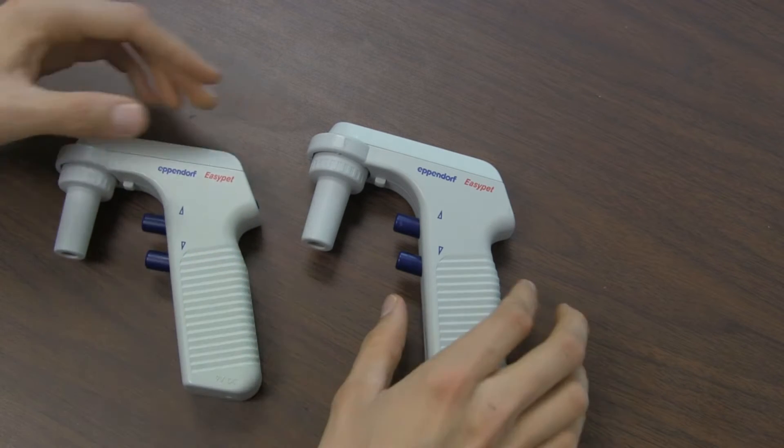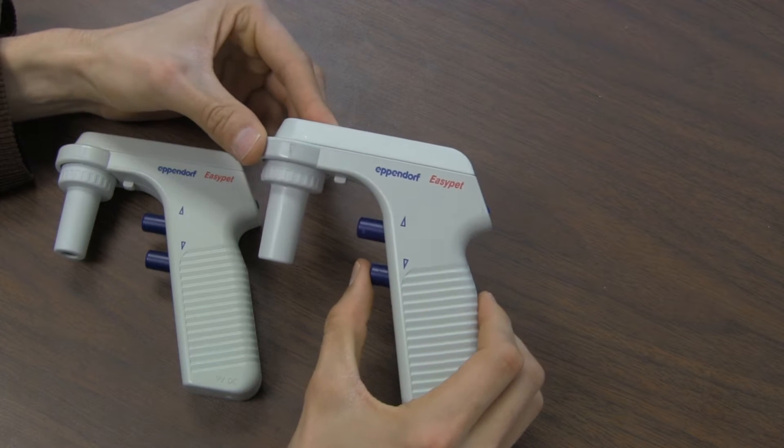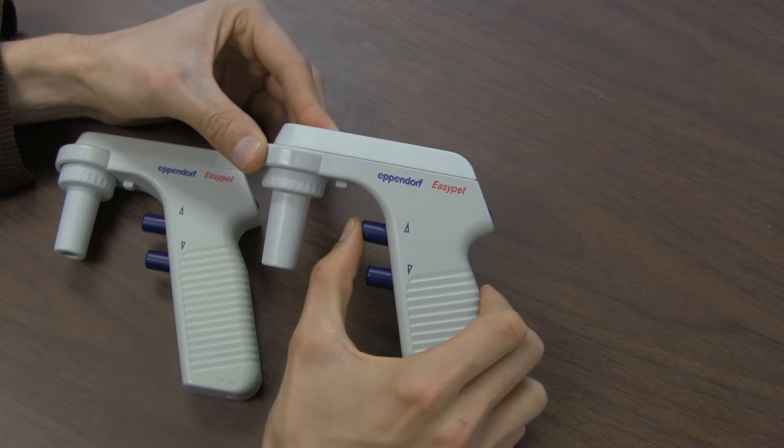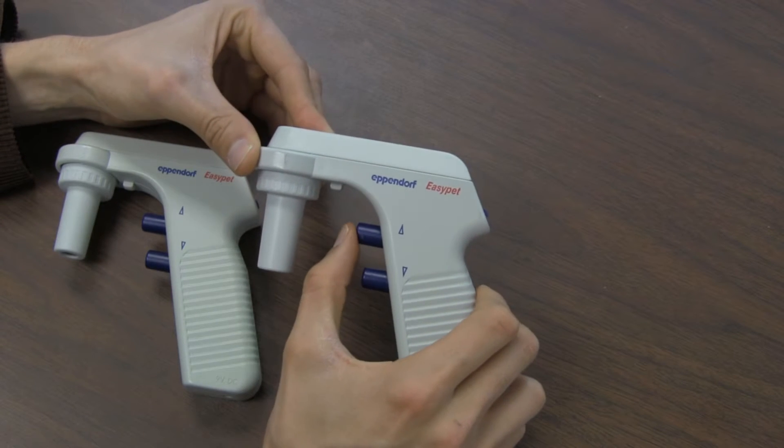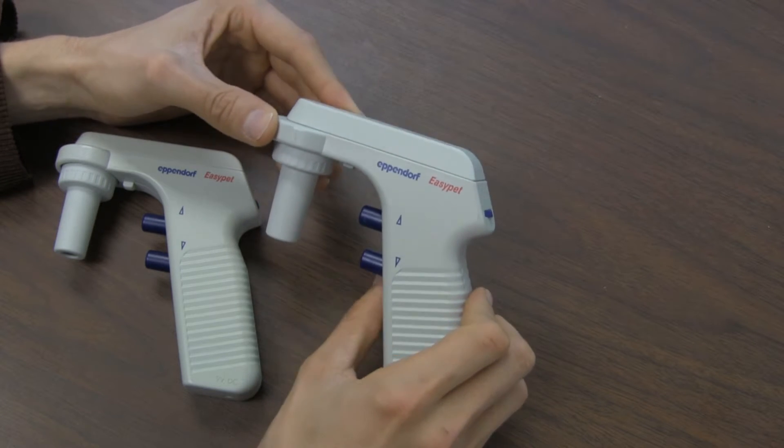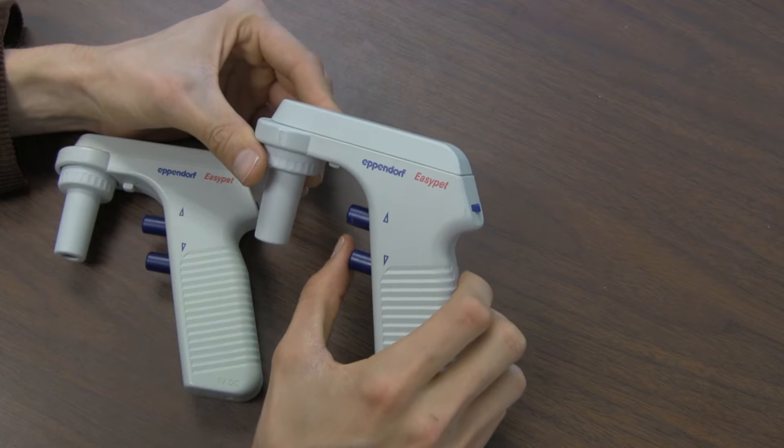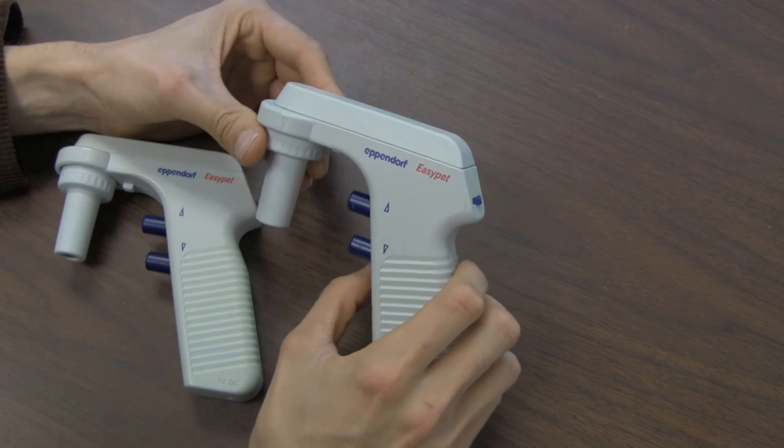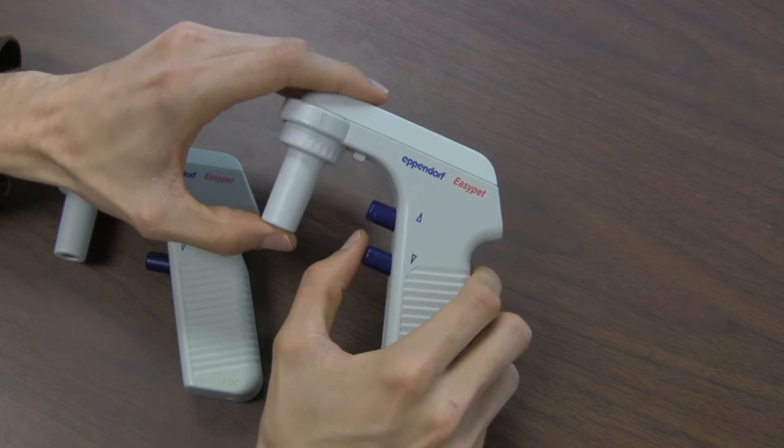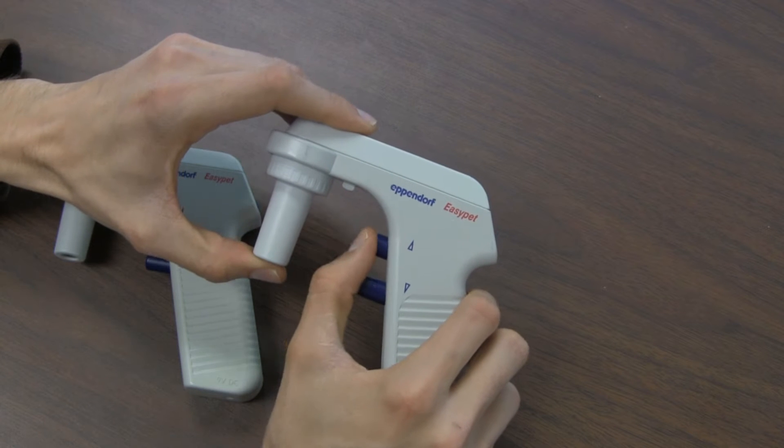And if yours, when you push the buttons, sounds more like this, where it just sounds like low-volume whir, then that means that the pump is disconnected from the motor inside. And also you'll notice that it's not working because there's no vacuum or pressure.